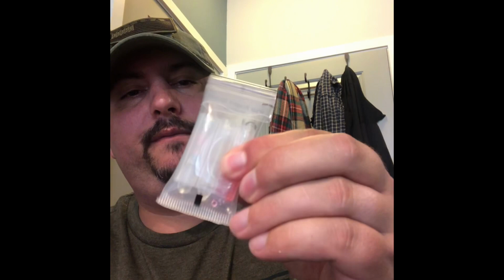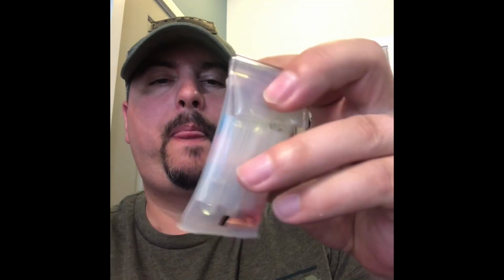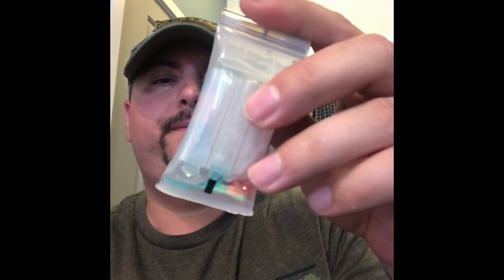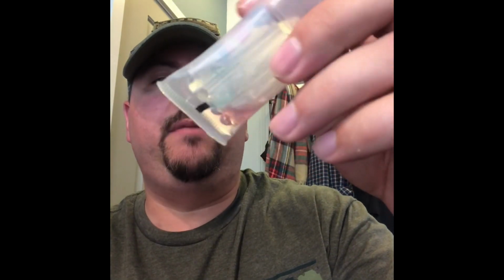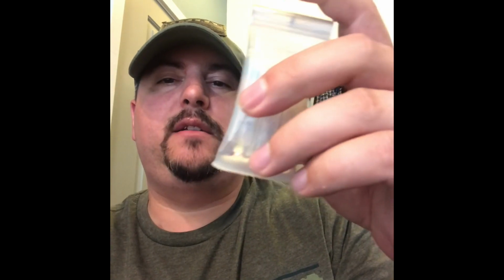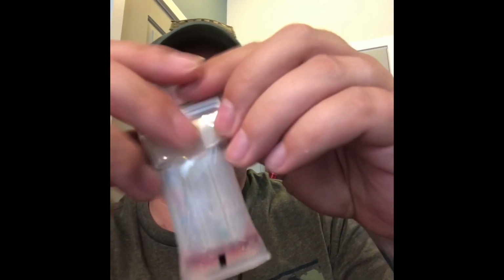And now we break left to right. Wow, pink. Go figure. It's already pink. And there's some blue. I mean, of course it's going to react. It's like with any anti-venom for a snake bite, they use the venom to create that. So I don't think you have to be a scientist to figure out that this is going to work the same way. Again, there's nothing in here but air. I wouldn't test air to charge somebody on a presumptive positive test for cocaine.